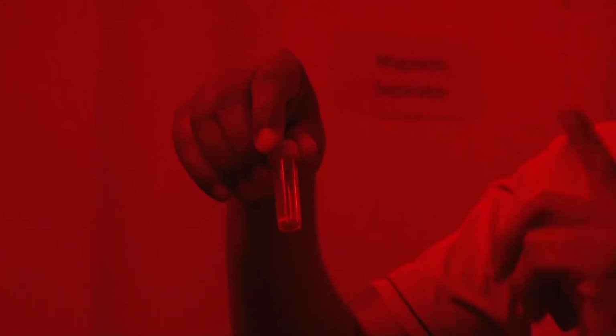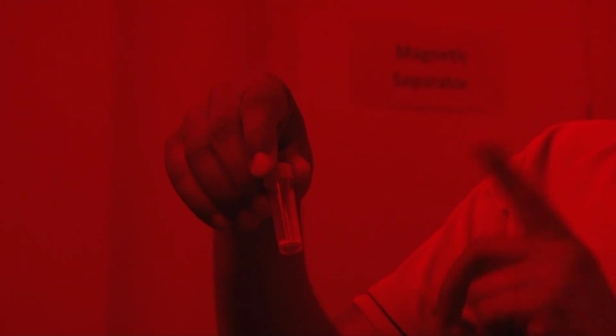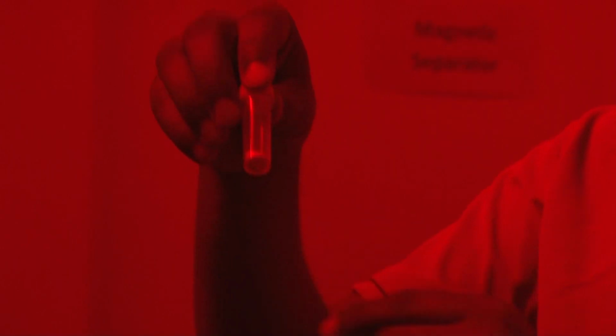So after doing the HF, because there will be some fluoride present in your sample, to remove the fluoride you have to treat your sample with HCl for 15 to 20 minutes, to remove the fluoride which is present after the HF treatment. So once you have done the HF and HCl treatment and dried the sample, you will get your quartz. So this is the quartz.